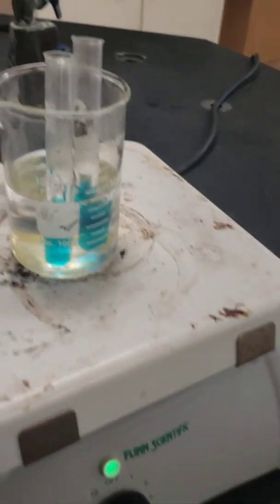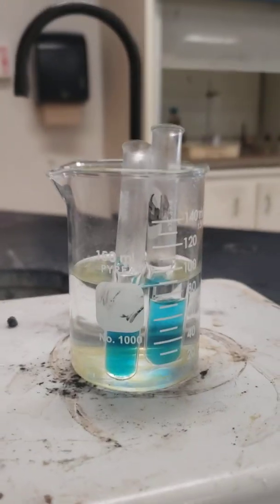So again, I'm just trying to observe, see if there's any kind of change.